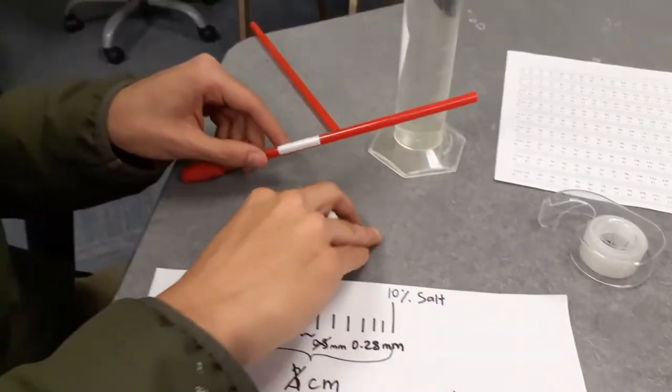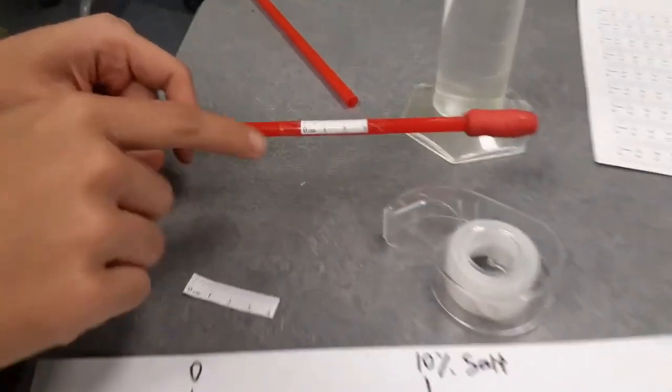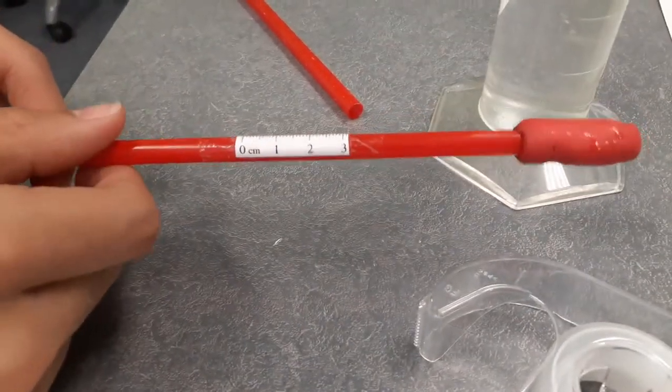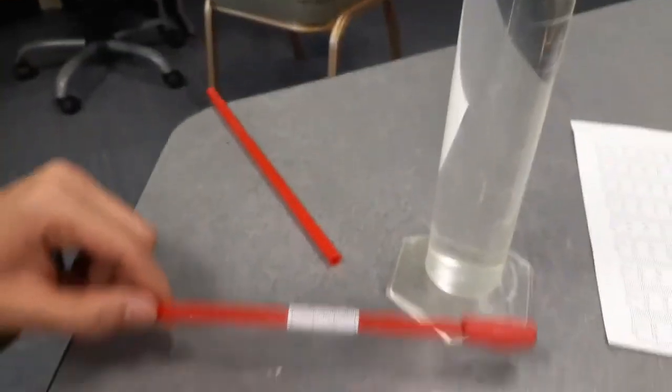Now, if you want to do this yourself, print out one of these rulers from online and tape it very, very carefully onto your salinometer. You want to make sure no bubbles are caught, or else it'll skew your results.